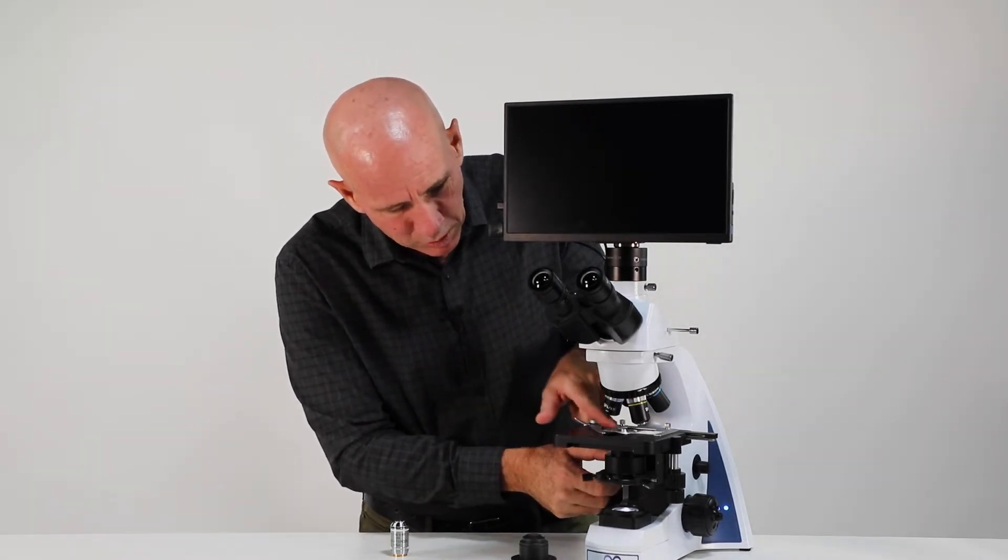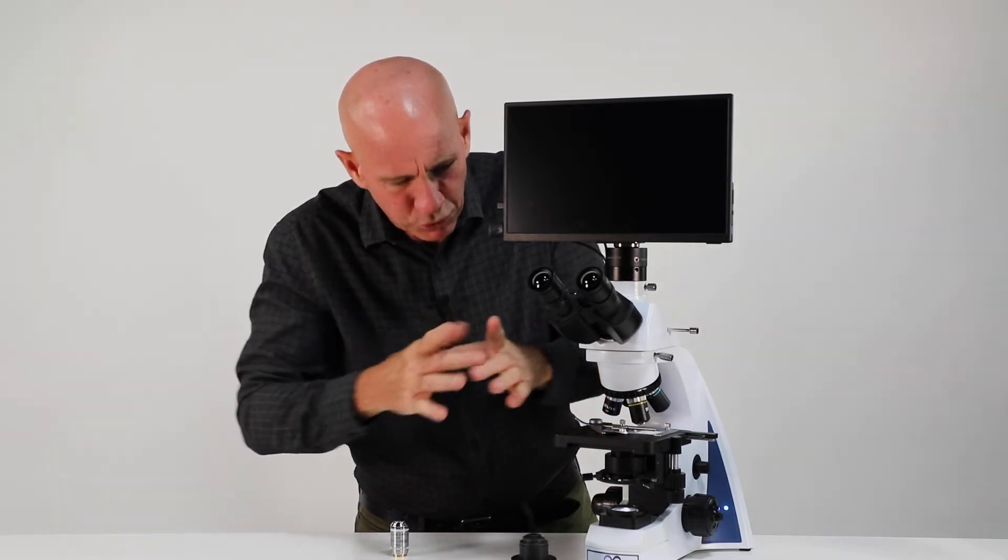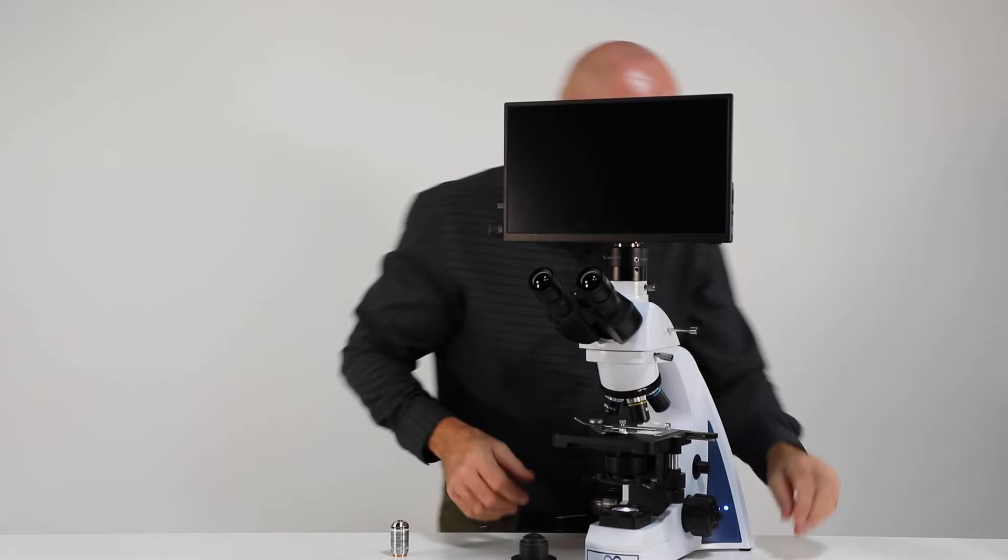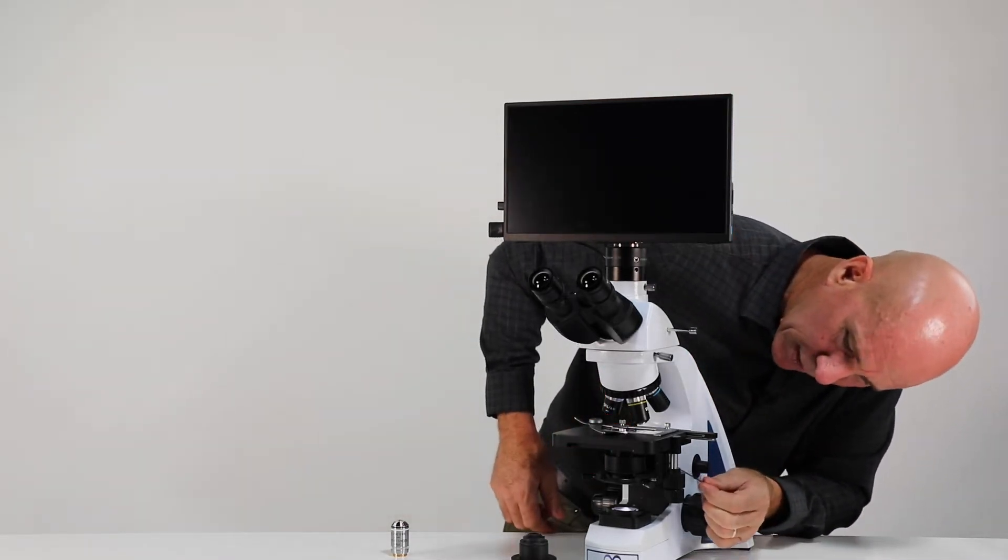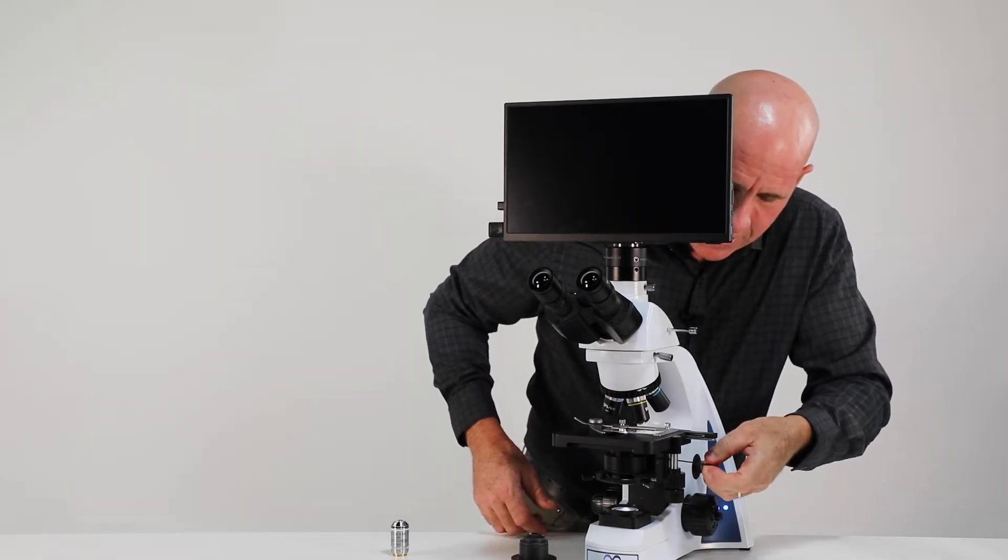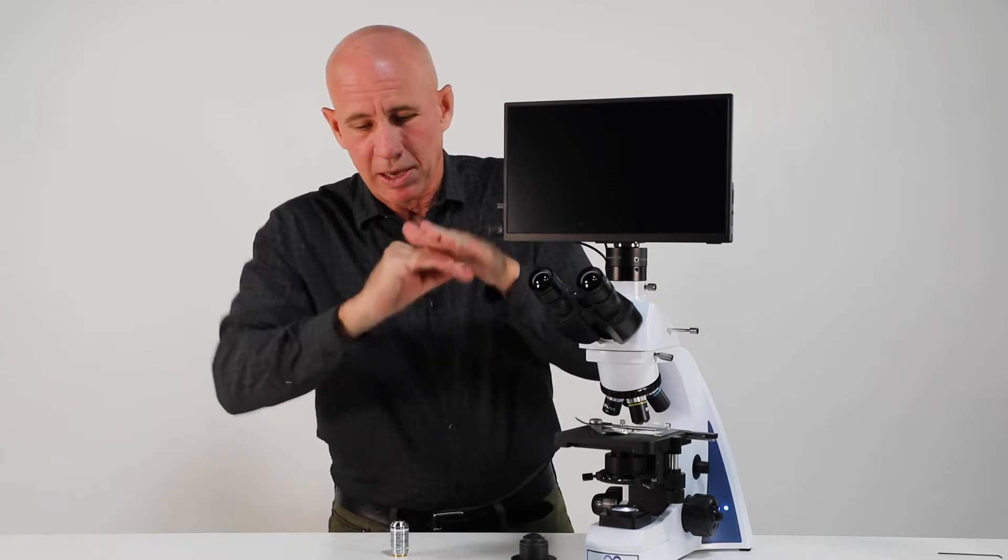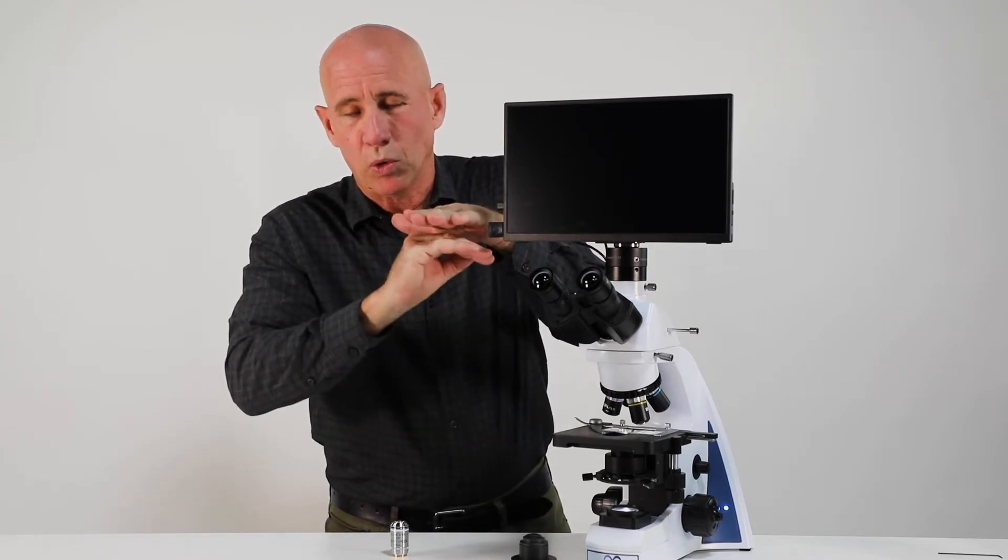And that little silver pin has been adjusting itself because it's spring-loaded right now. So as I come up and down, I want to get that perfect height where that oil has spread out pretty wide. And now if I just tighten up that little bitty set screw right there, I have now locked that pin in position. So now my condenser will come up to that perfect point every time.